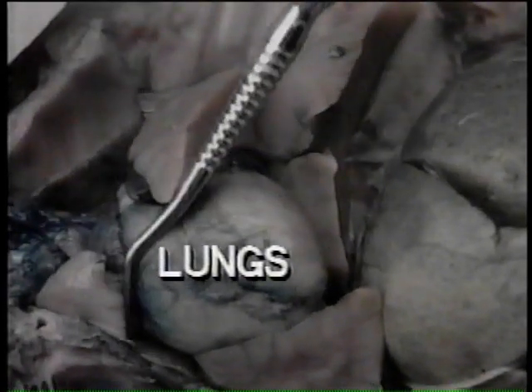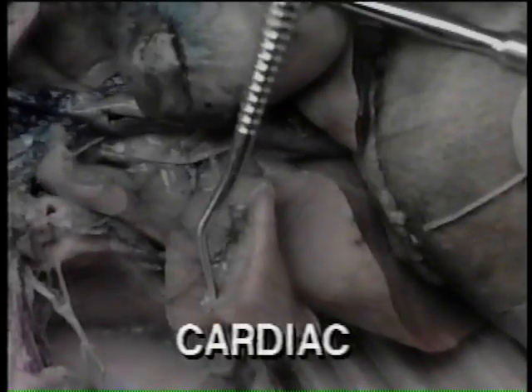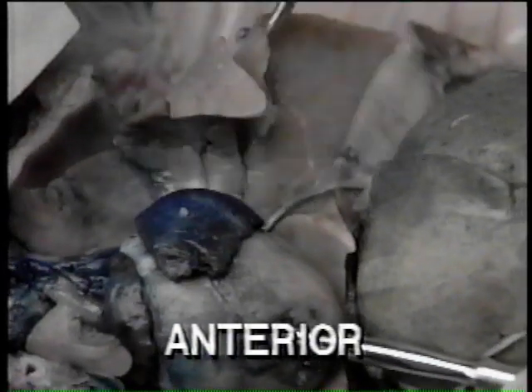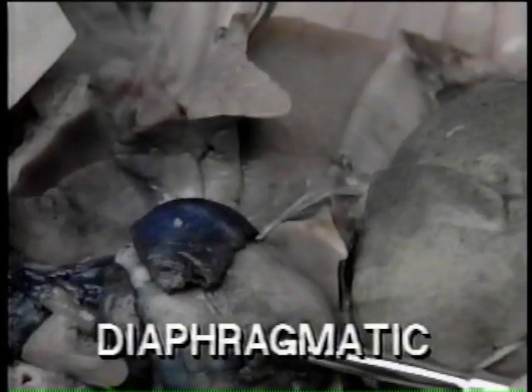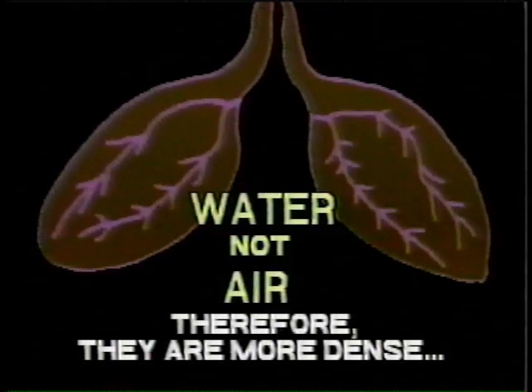The lungs consist of 4 lobes on the right and 2 lobes on the left. The 4 on the right are the apical lobe, the cardiac lobe, the intermediate lobe, and the diaphragmatic lobe. The 2 on the left are the anterior lobe and the diaphragmatic lobe. The lungs of the fetal pig are filled with water rather than air and are therefore more dense than the lungs of an adult.